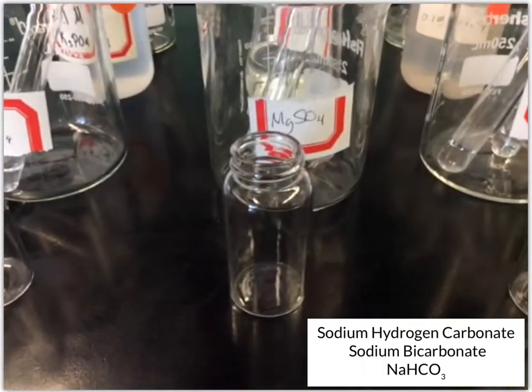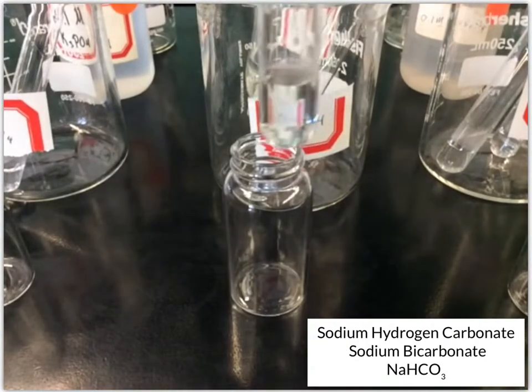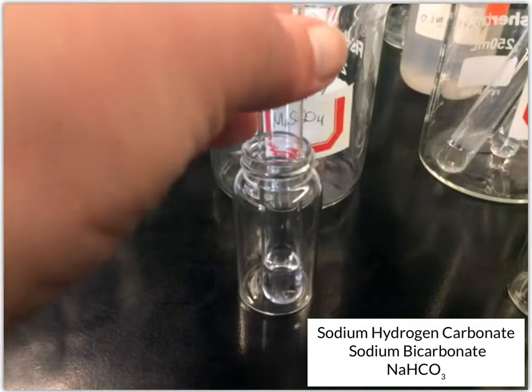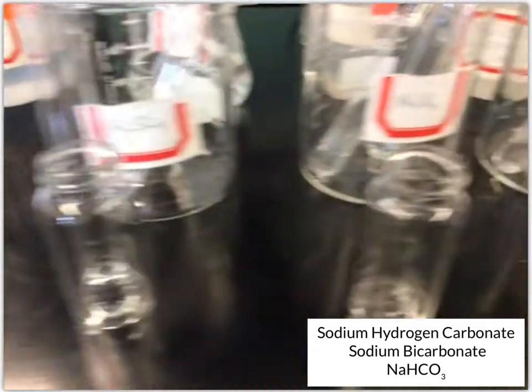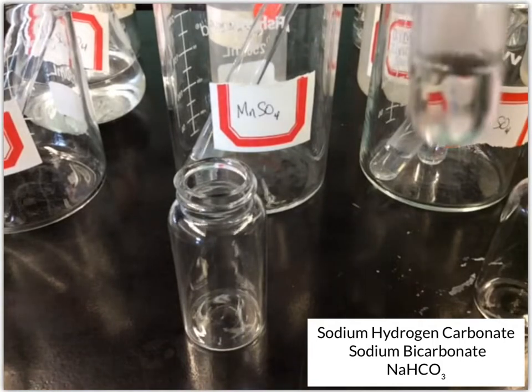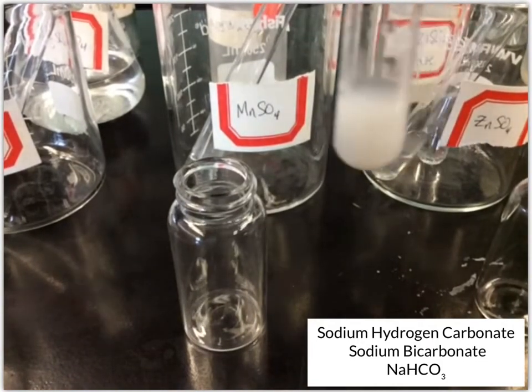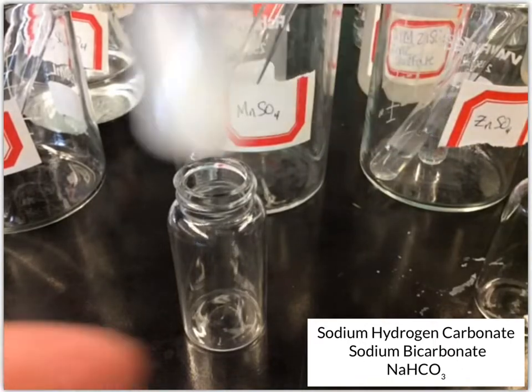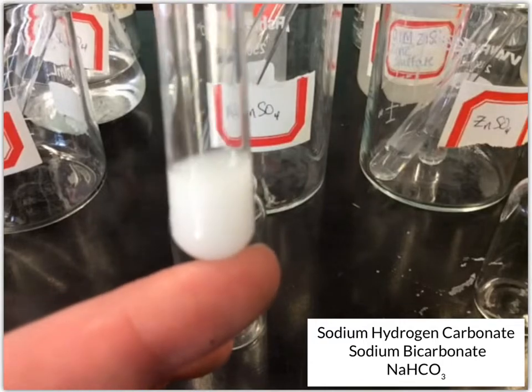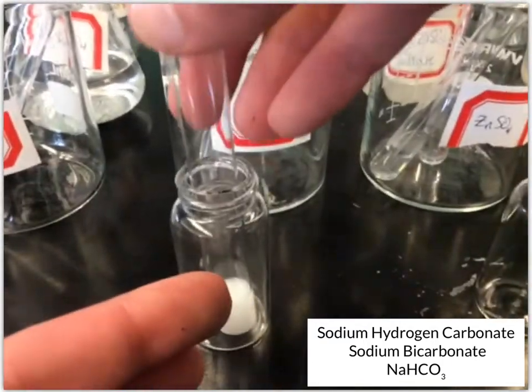We've got magnesium sulfate. No change. And then manganese 2 sulfate. Okay, so it looks like this one changed. We've got another white solution, so we've got some solid floating around in there.